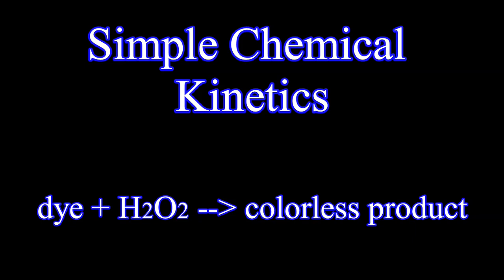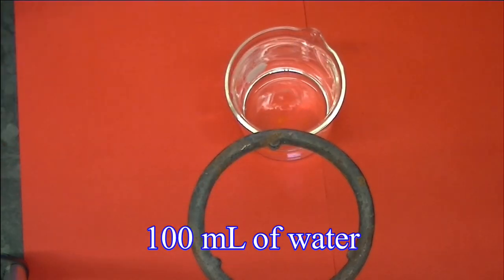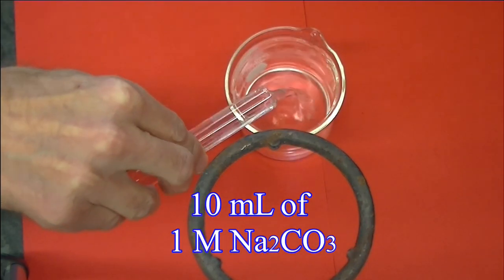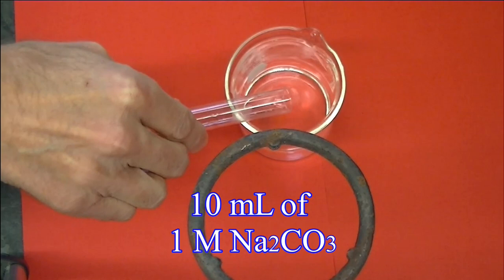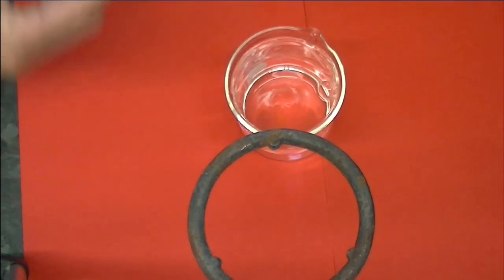In this video, we'll learn how you can use simple materials to find the order of the reaction with respect to dye in the reaction between dye and hydrogen peroxide. We'll first take 100 milliliters of water and place it against a red background. We'll add 10 milliliters of 1 molar sodium carbonate and 10 milliliters of 3% hydrogen peroxide.